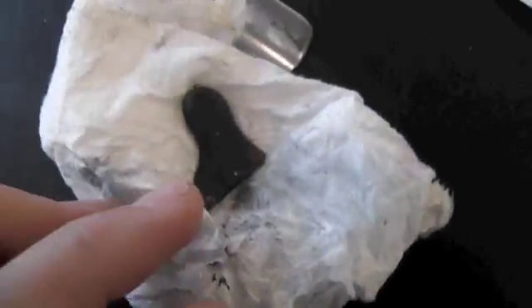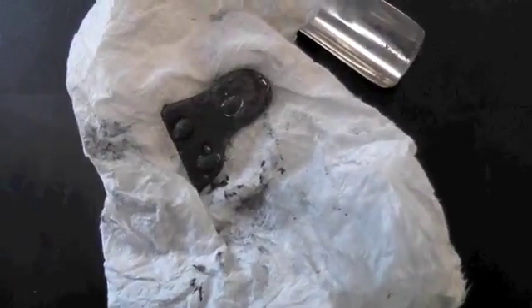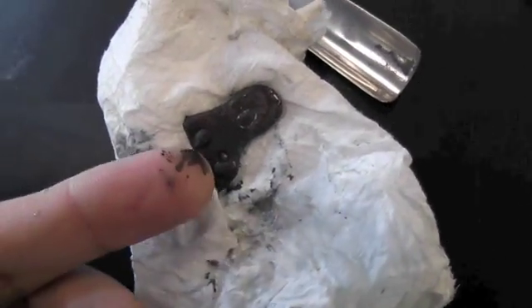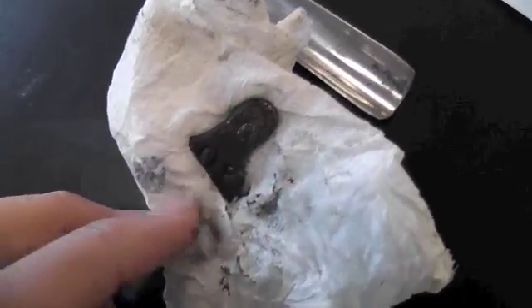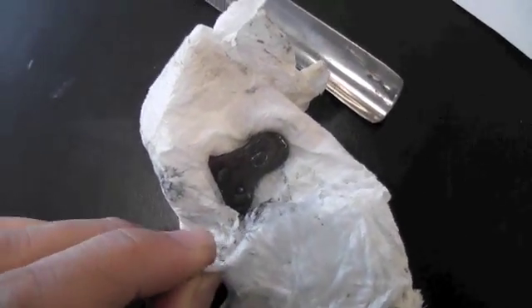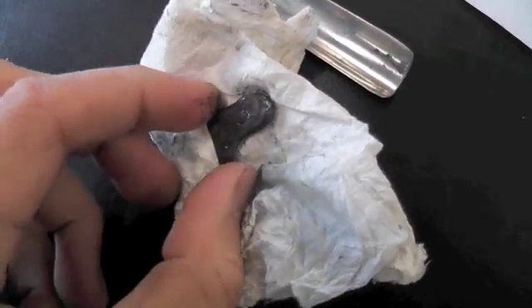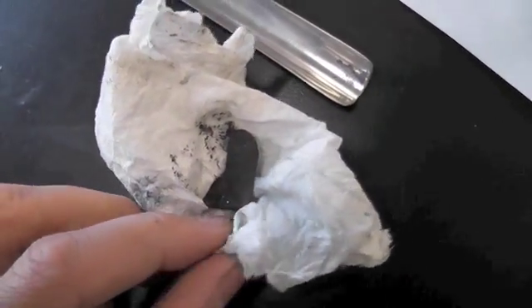See now that the color is very different. It's not that shiny anymore. You can also see some brown spots on the edges, especially on this side. You can see just touching it, got my finger all dirty. That is the copper solid forming on this piece of lead. Again, coming out of the solution and becoming a solid. It sees a little bit brown on the edges. Definitely not the shiny piece of lead it was before.